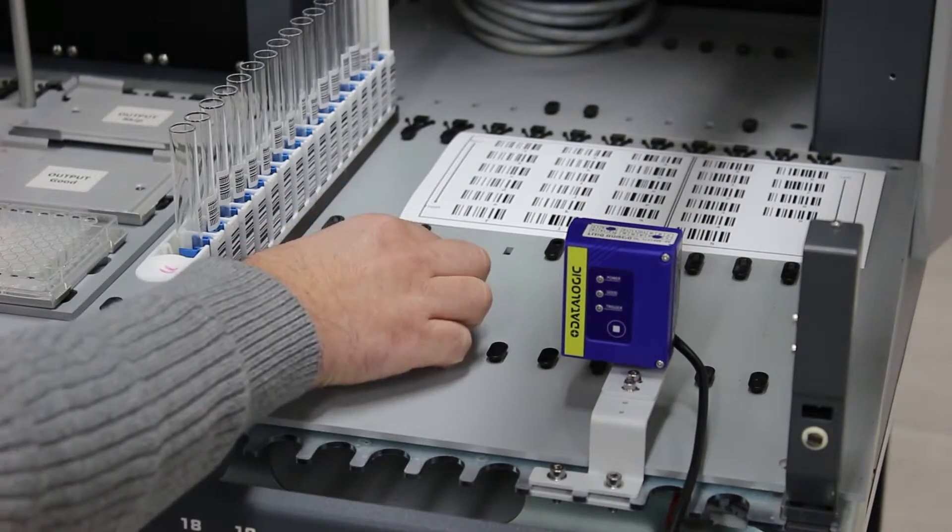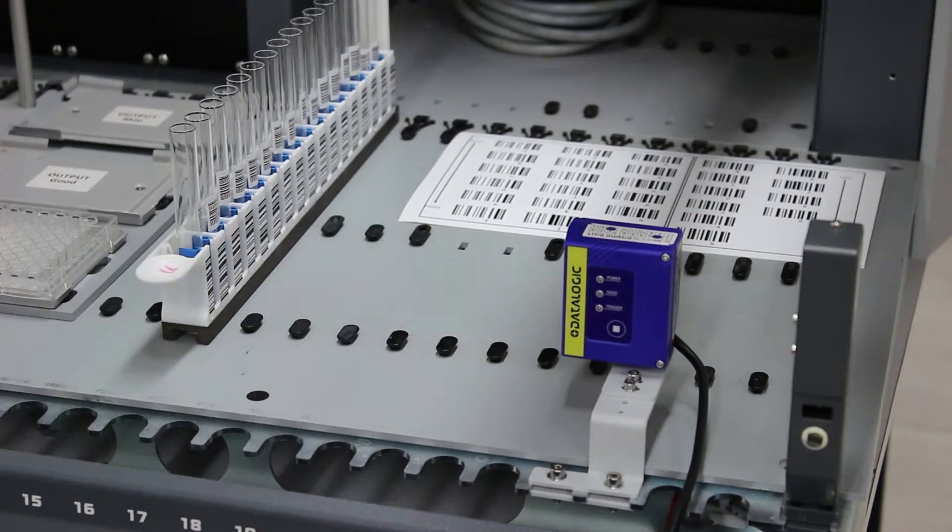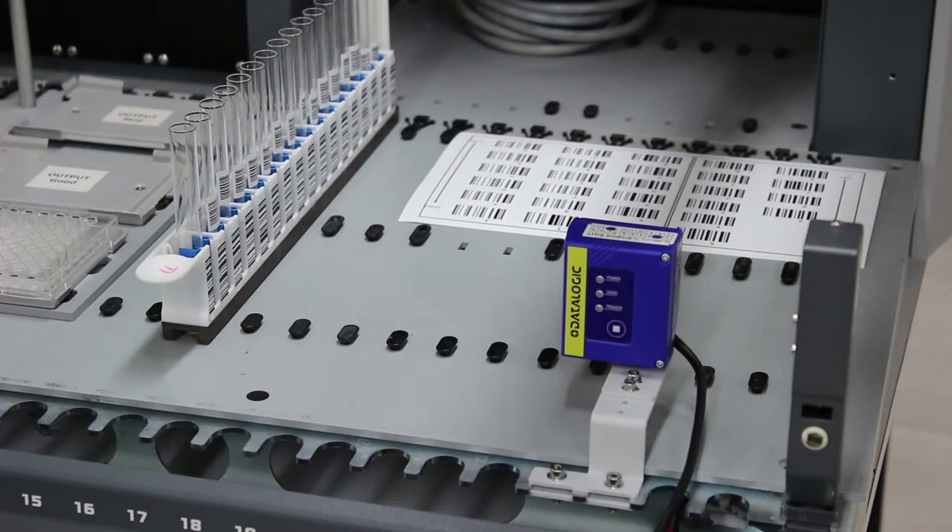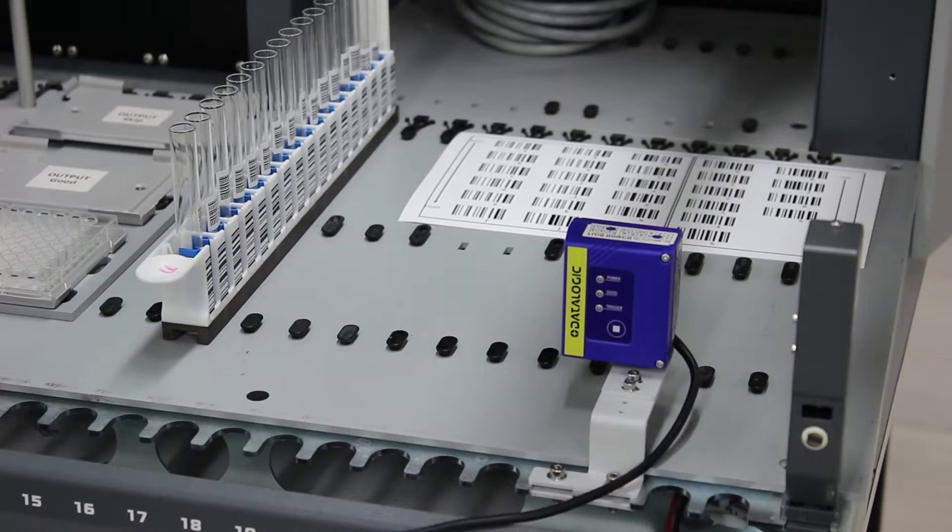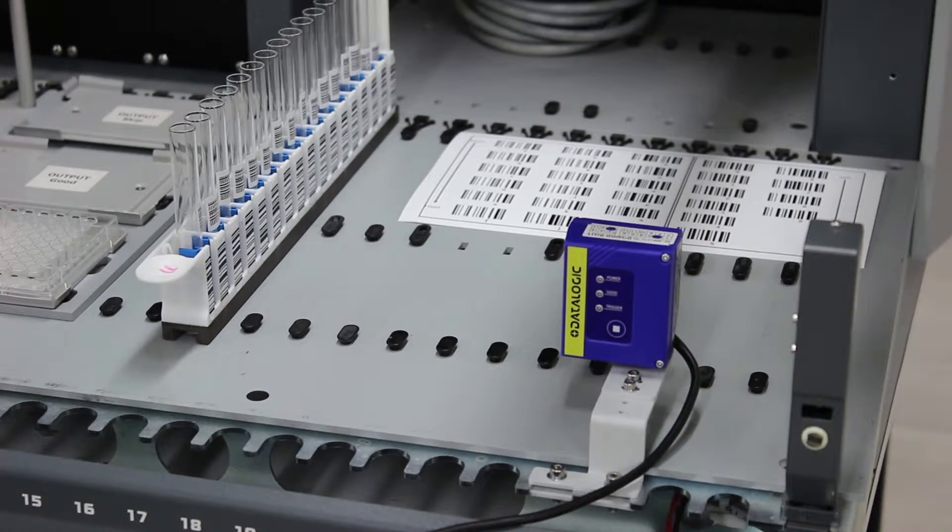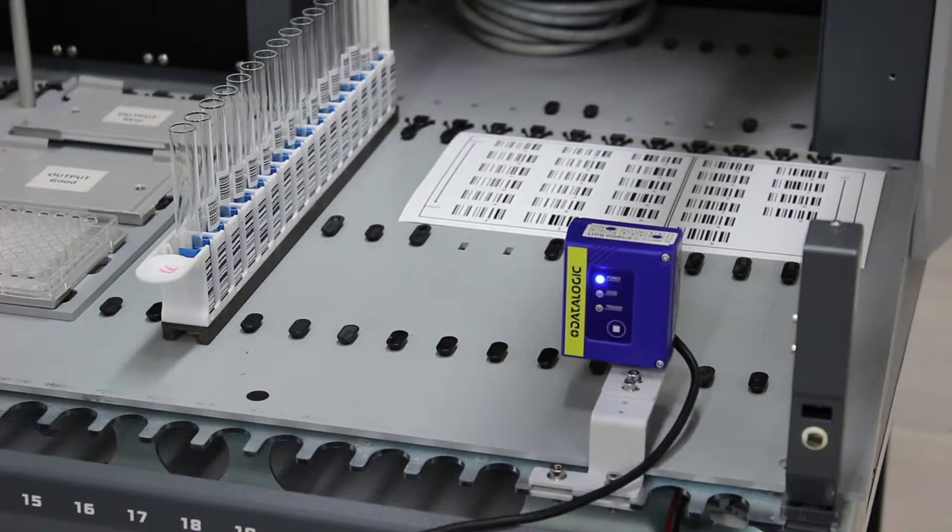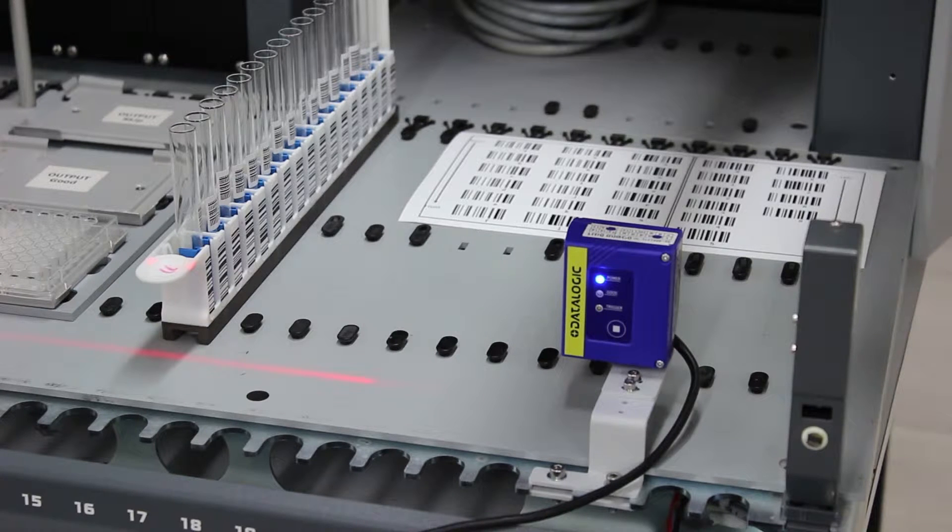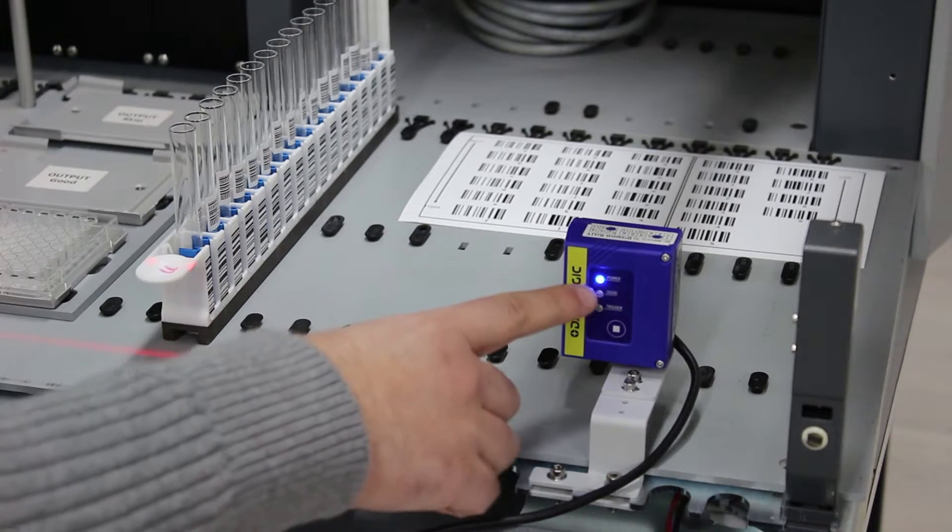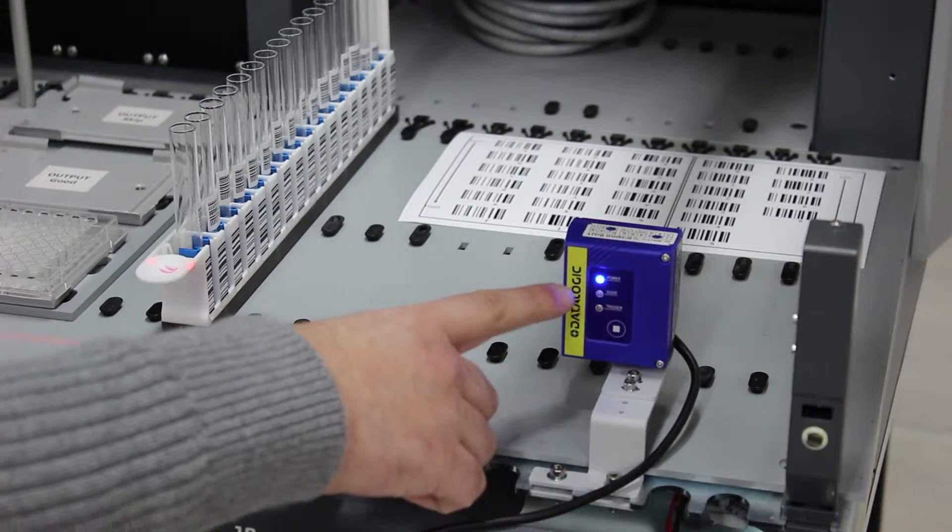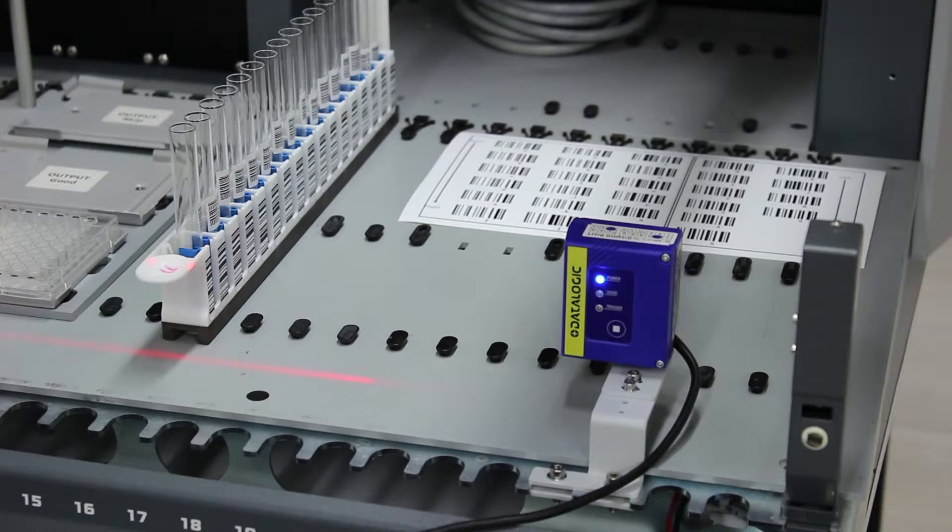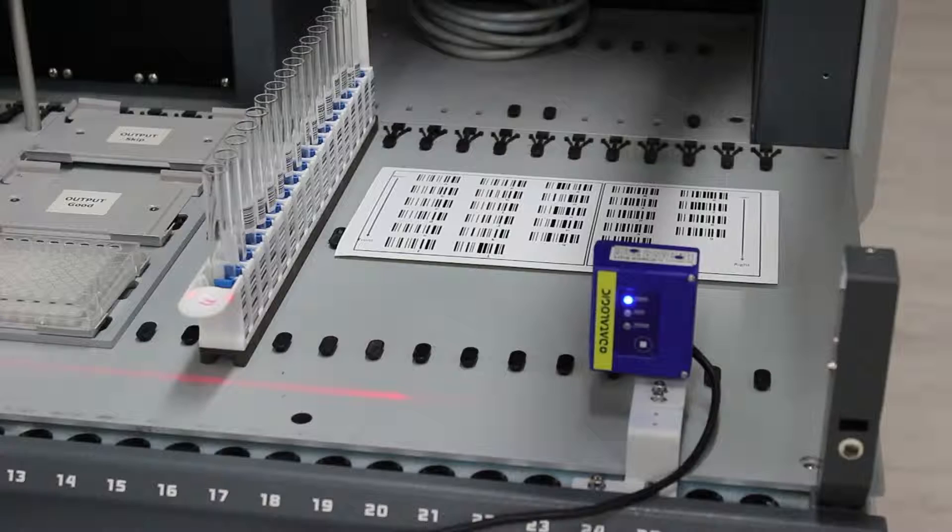Install the software and hardware drivers and connect the software protection dongle. Connect the barcode reader USB cable. Once the barcode reader is connected and identified, the blue power LED will turn on. A red scanning line will also be visible.